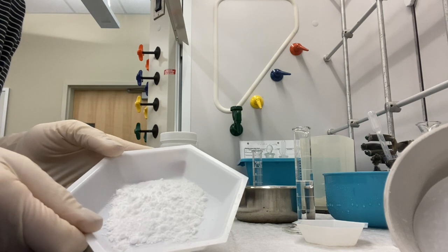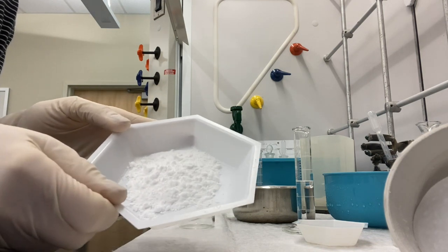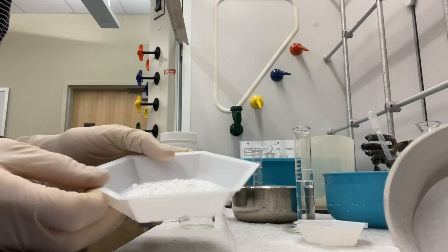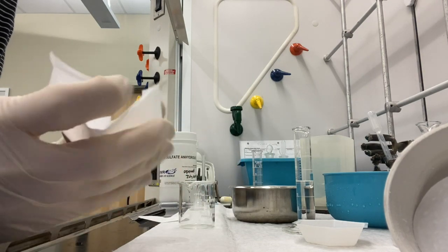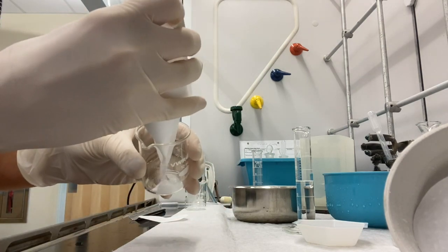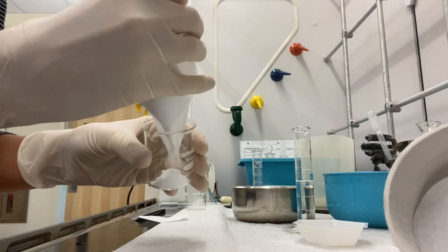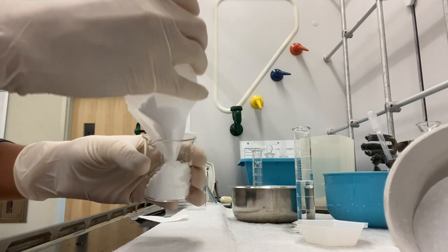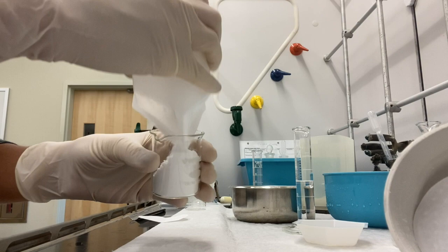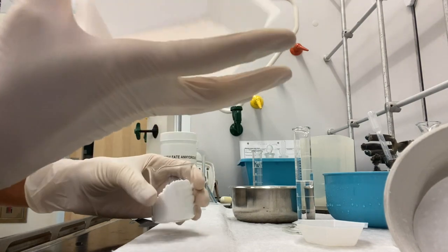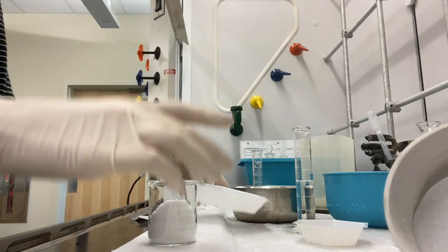Okay, so I've scraped out all of that nice white solid from the Buchner funnel from that vacuum filtration. And now we just want to make sure that there's no water whatsoever in our solid. It may look dry, but microscopically there's probably some water left over in here. It's not totally dry. So we'll test it now.